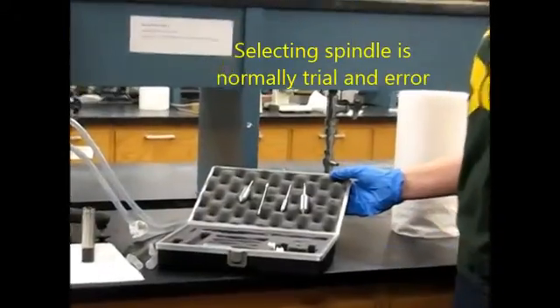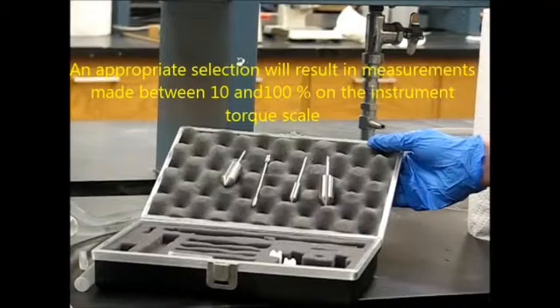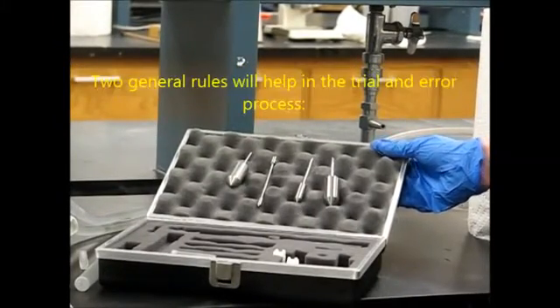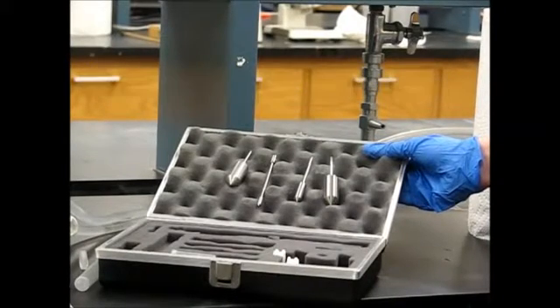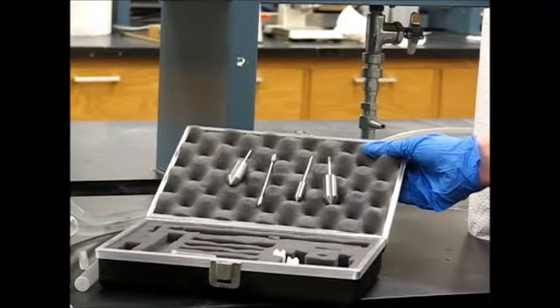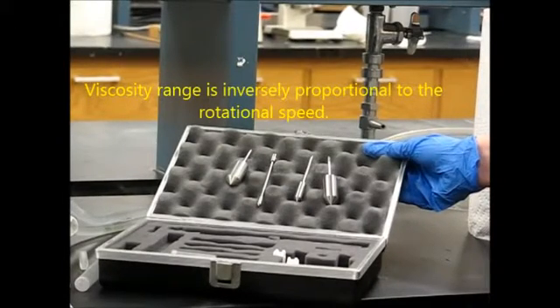Selecting a spindle is a trial and error process. An appropriate selection will result in measurements made between 10 and 100% on the instrument torque scale. Two general rules will help: first, viscosity range is inversely proportional to the size of the spindle; and second, viscosity range is also inversely proportional to the rotational speed.